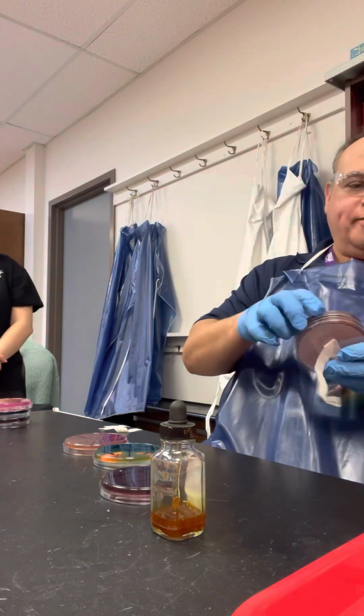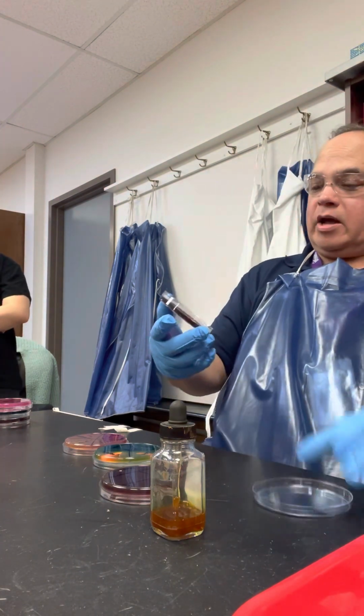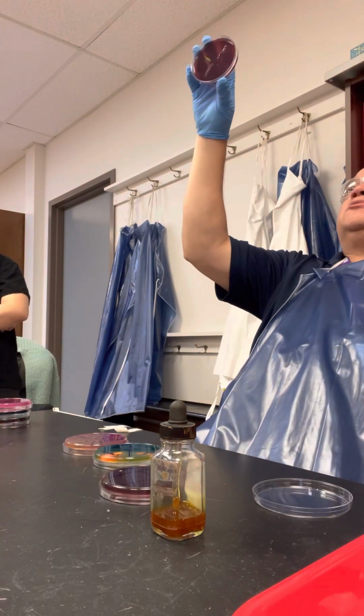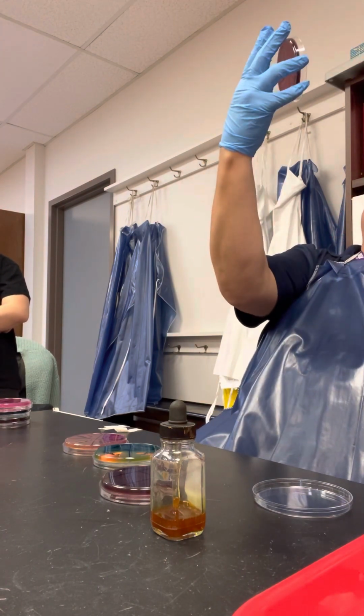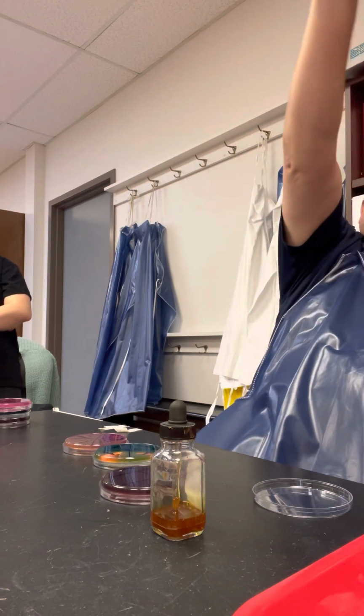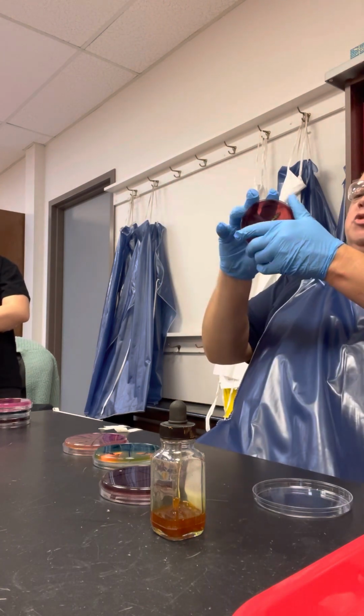All right, let's look. Oh, good. So let's look at these. This is 2. Can you appreciate what happened? Ooh, nice, that's great. You look at this plate, one of them is red. There it is. It almost looks purple, right? That's a lactose fermenter. One of them is metallic green.